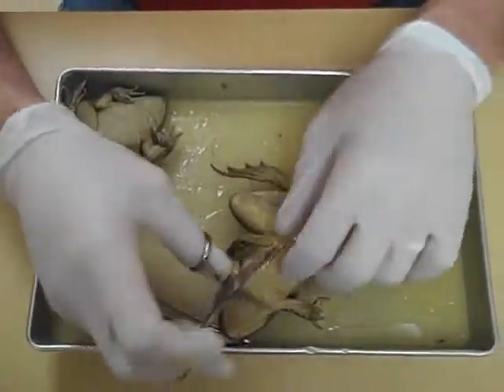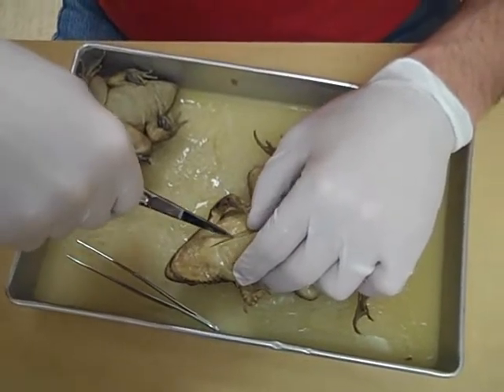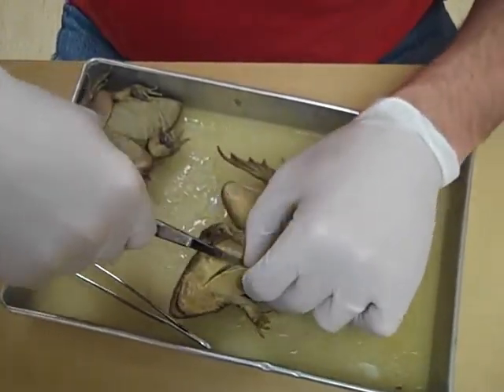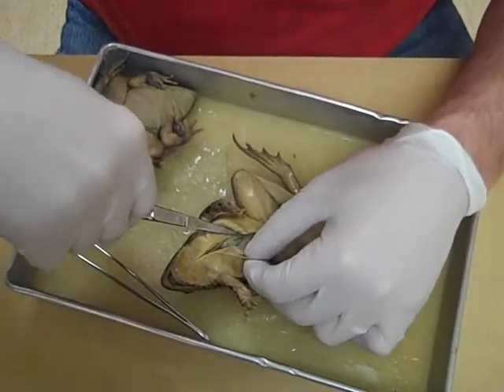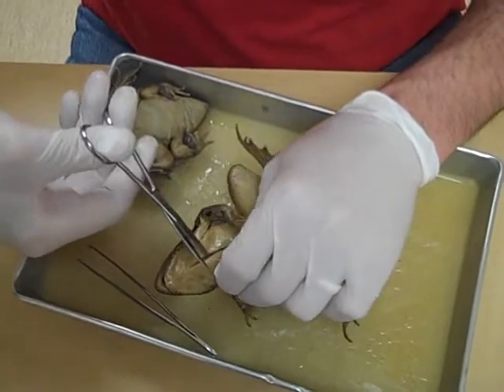You're going to go all the way to the top. Now we've got to cut to the side. Sometimes kids are like, now we just want to look inside, but they won't be able to see much because it's not that open. We need to open this frog all the way up so we can have a good look.